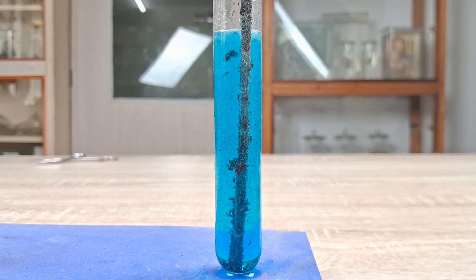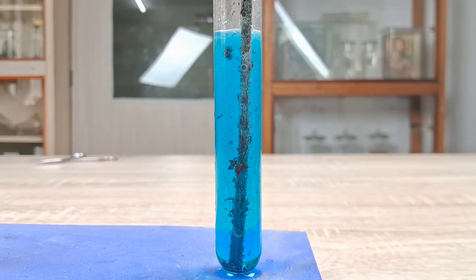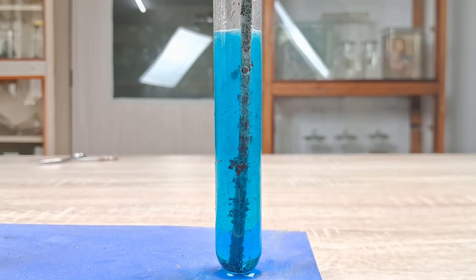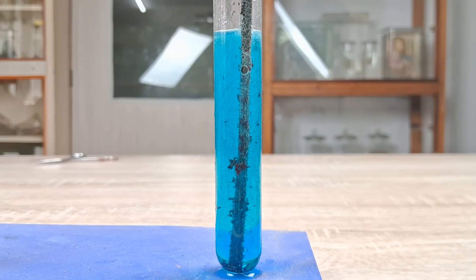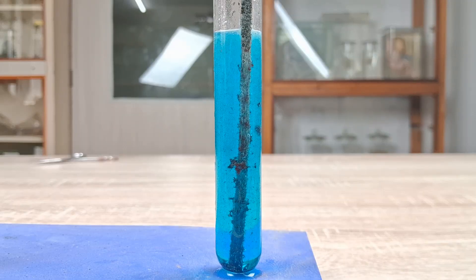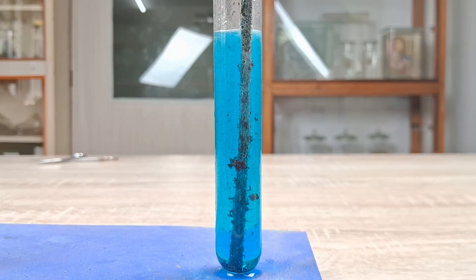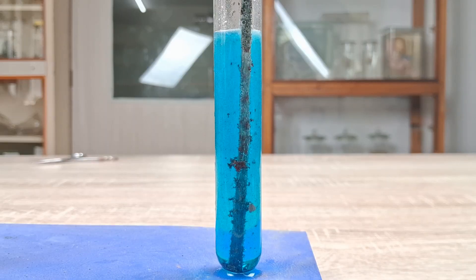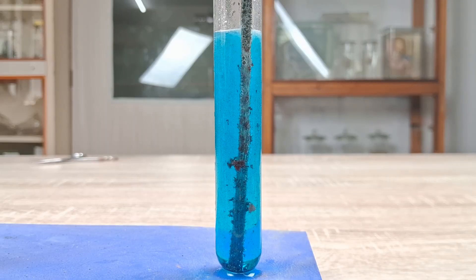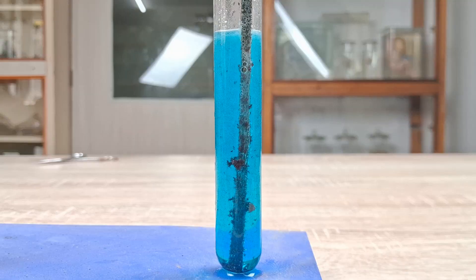If the reaction mixture is left undisturbed for several hours, a rich deposit of copper is formed in the test tube, and the blue color of the solution is also seen to change into a clear, colorless liquid.